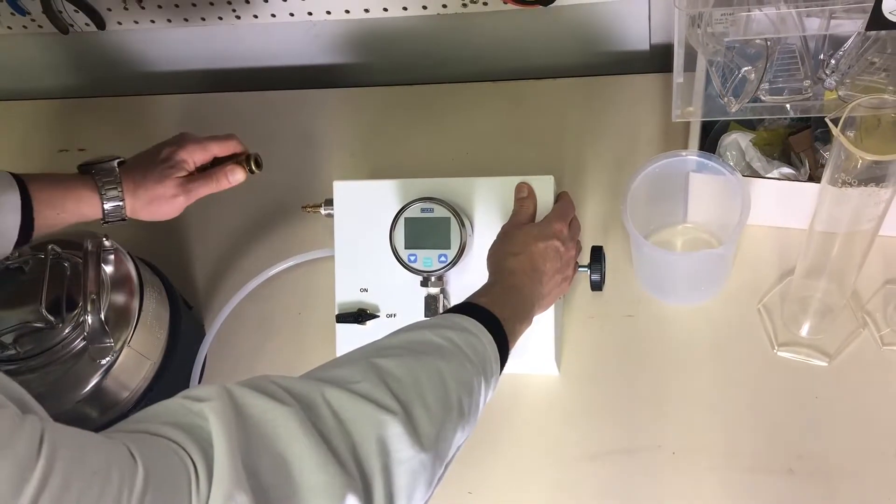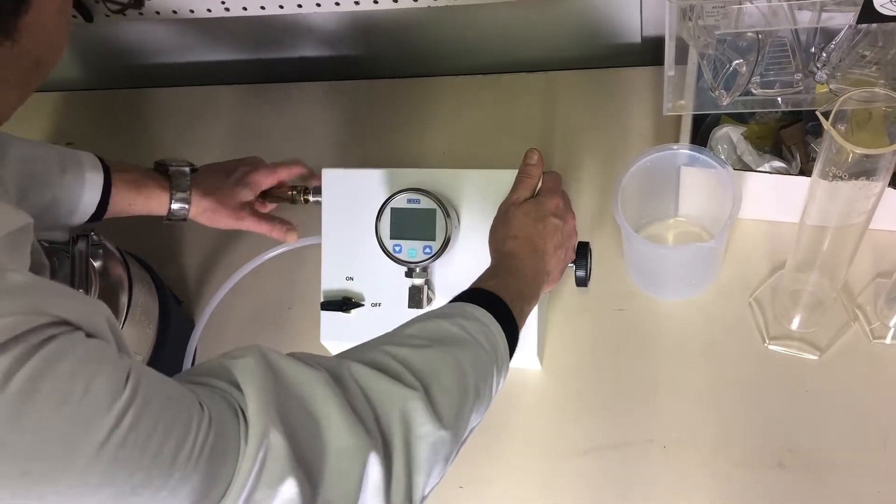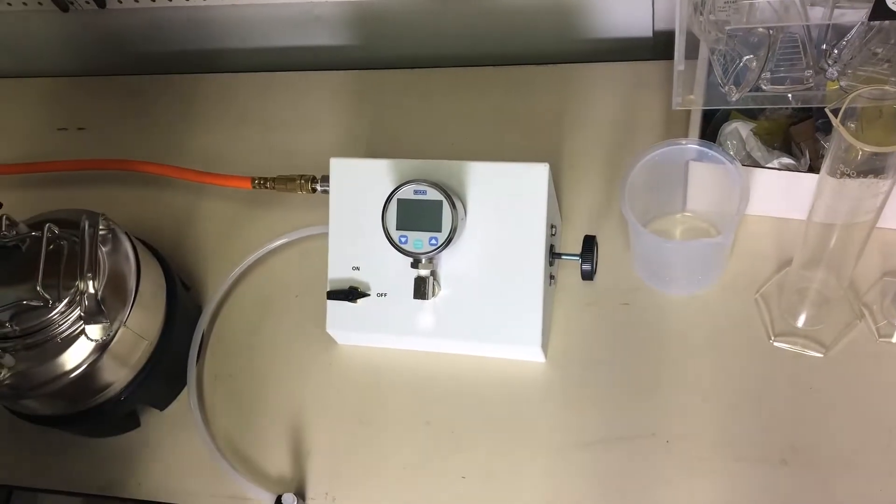So you retract the ring, you hold this side, push with this side, let go.